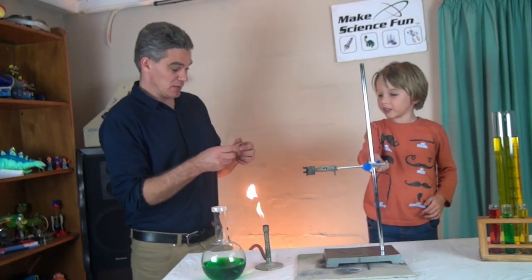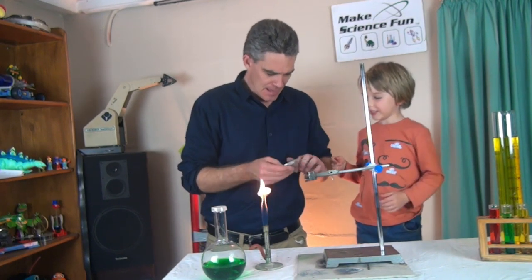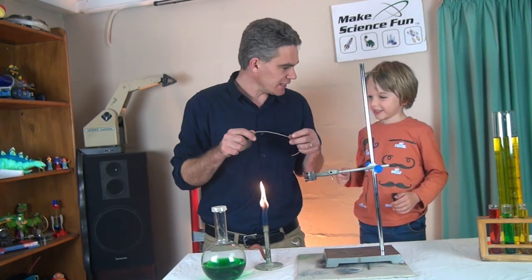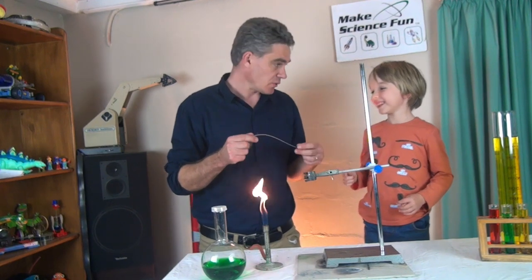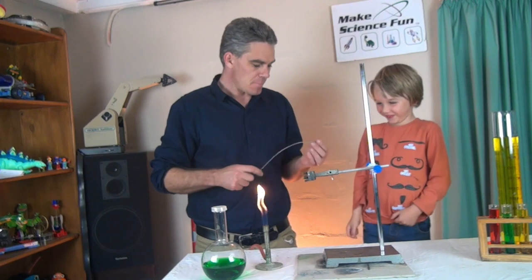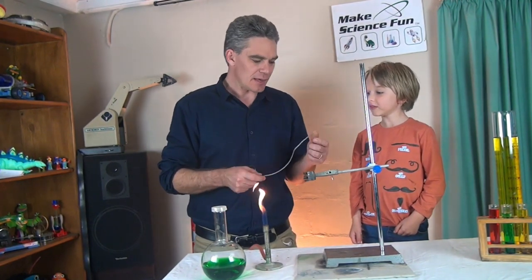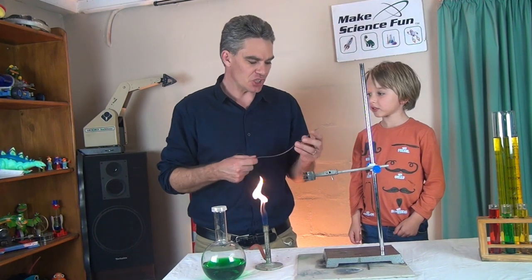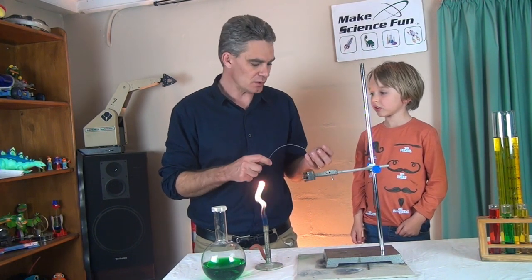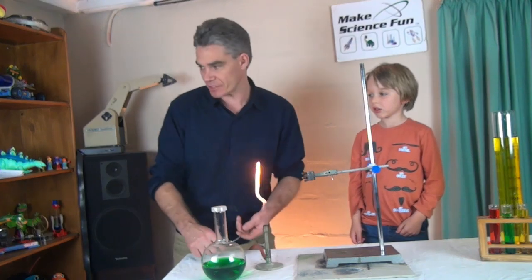Here's the magnesium metal. Now, I've got a whole roll of it. And notice how shiny it is. Will it burn? I hope so. Metals are shiny. See how shiny it is? And ductile. See how it's able to be bent? And it's able to be hammered into sheets. That means it's malleable as well. It's a good conductor of heat, and it's a good conductor of electricity.